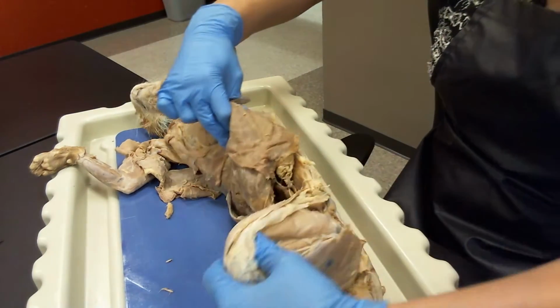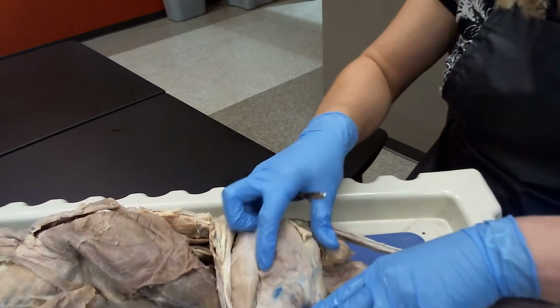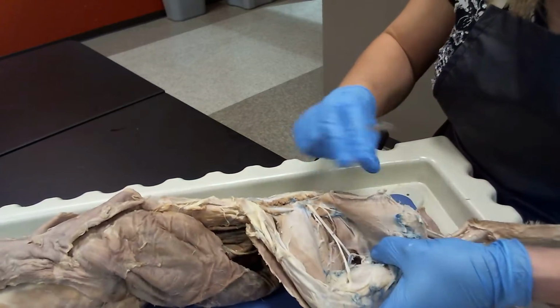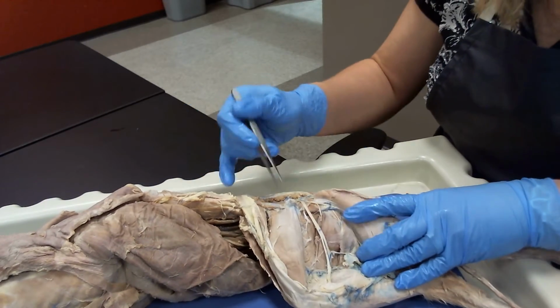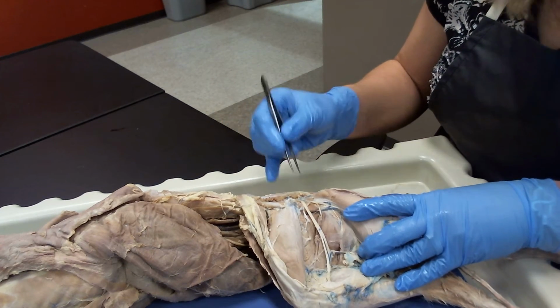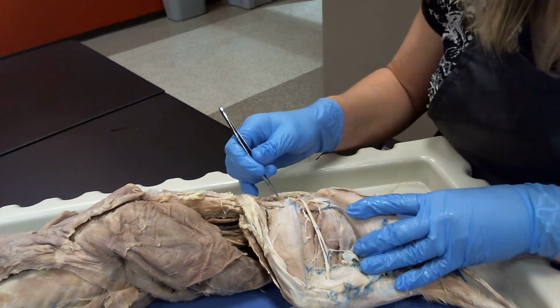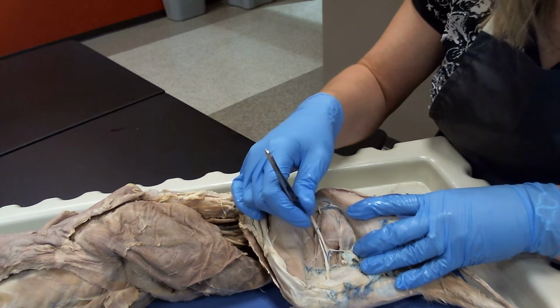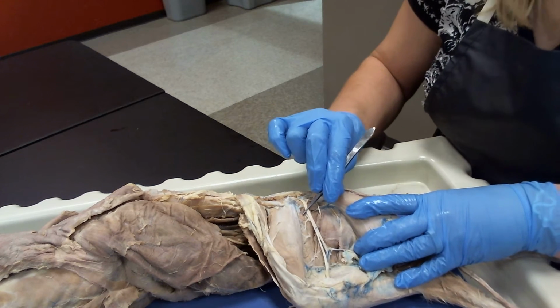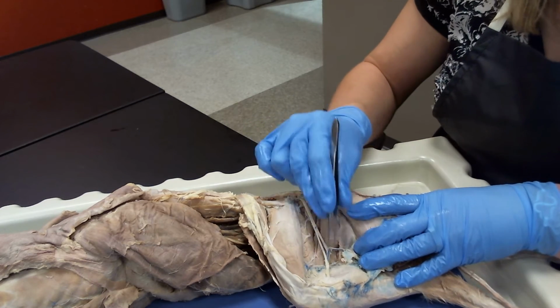So now we want to go to the dorsal aspect of the cat. So once we go to the dorsal aspect of the cat, we're going to look at the more distal aspect nerves first, and then we will flip the cat around and look at some of the nerves that are right up there adjacent to the tail. So these distal aspect nerves that I want you to be able to see, we've got this large nerve running down until we see him split right here. This is your, if you're looking in your cat book, this is your ischiatic nerve. In you and I, we would simply call this our sciatic nerve. Very, very important nerve to know.